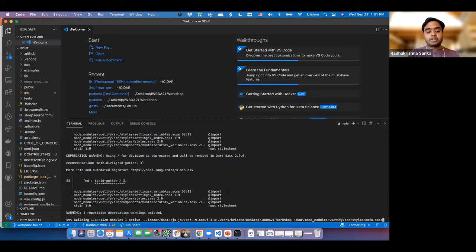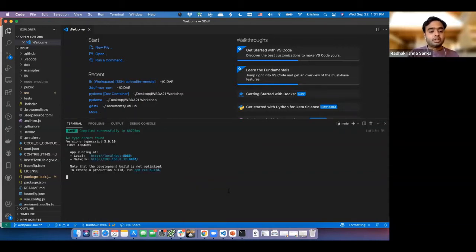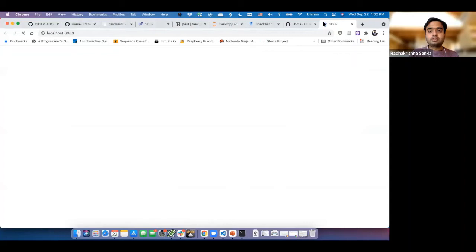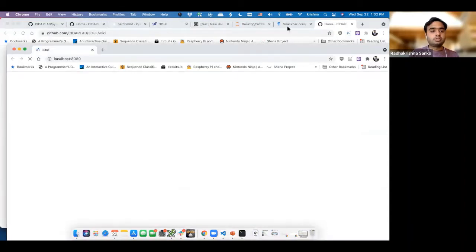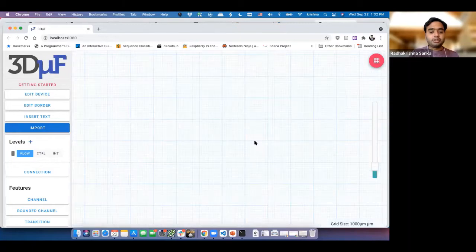the good thing about this is once I run this vue serve, every time you make a change onto the code base, it'll automatically compile the differences, which means that you don't need to manually compile every time you make a change. Rather, it'll update it and your browser will be able to show you the latest version of it. So now that this is done, all I need to do is open it on the browser. And there you go. You have 3DuF compiling on your own computer.